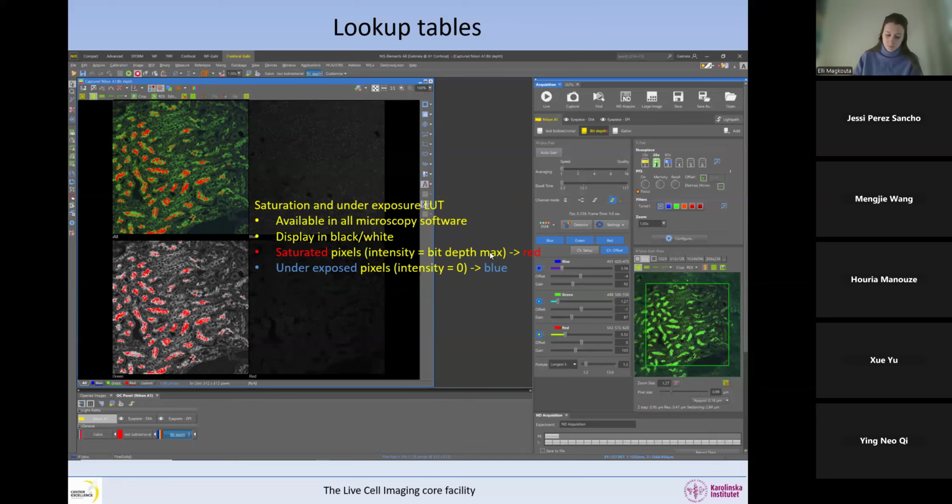Okay, so if you have acquired the image in 8 bits, the pixels will appear red when they have the intensity 255. If you have acquired the image in 12 bits, which is the case here, then the maximum is 4095, and all the pixels that have the intensity 4095 will be color-coded in red. So that depends on the bit depth. And the underexposed pixels are those that have an intensity of 0.